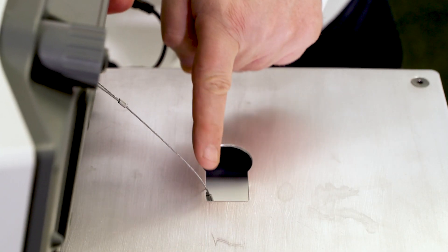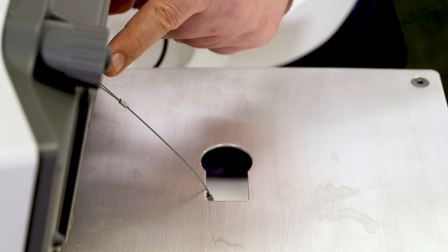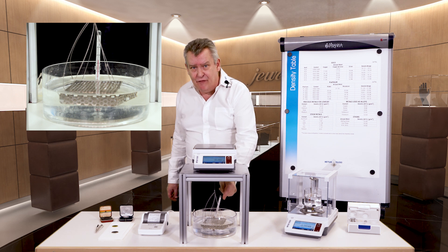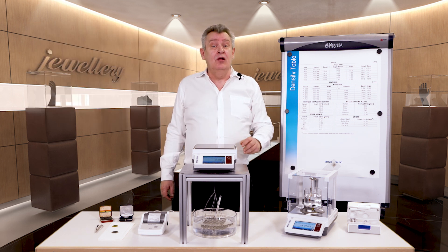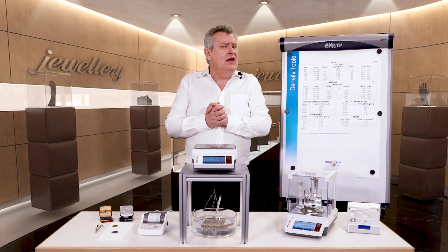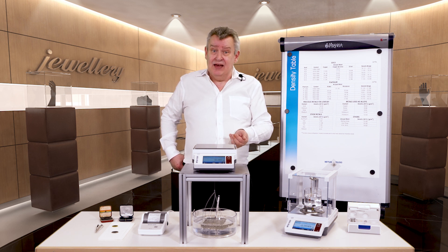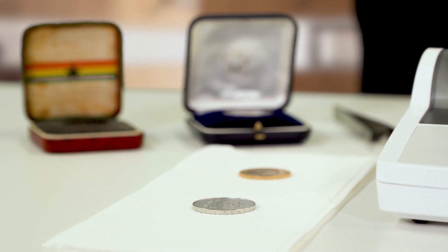We've made a hole in the top of the table construction to pass a cable through, which is suspended from the hook below the balance. This cable has a homemade weighing platform on the end, immersed in a vessel of liquid. We suggest you make a small hole in your weighing table and place the container with the auxiliary liquid on the floor. Don't forget to add a calibrated thermometer to the liquid to check the temperature, and we're all set to perform accurate purity determination of your gold, silver, or other precious stone or metal sample.